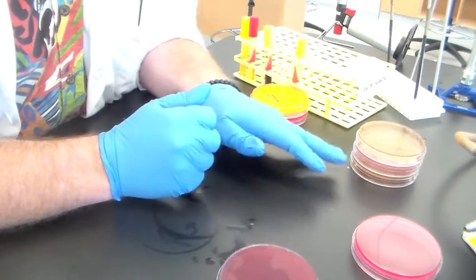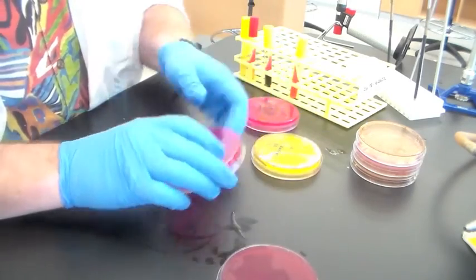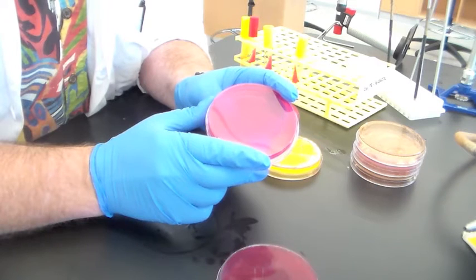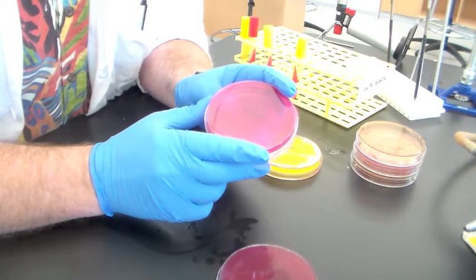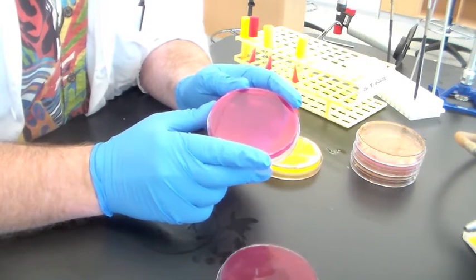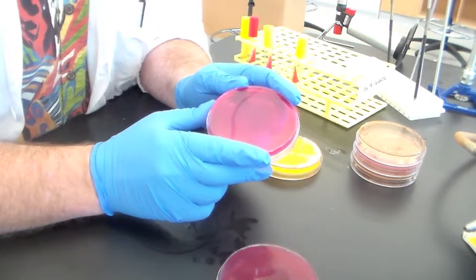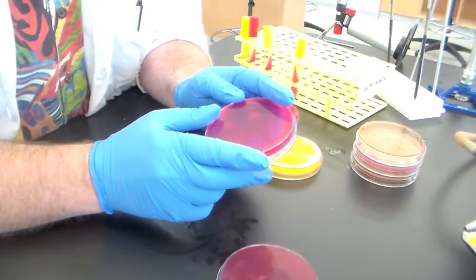Another media that you inoculated last week, which is also differential and selective, was the mannitol salt agar. From the name, two of the most important components are the carbohydrate mannitol and salt. The salt is the critical component in terms of the selective nature of mannitol salt agar. Staphylococci are capable of growing at 7.5% sodium chloride, which is the amount included in this media.